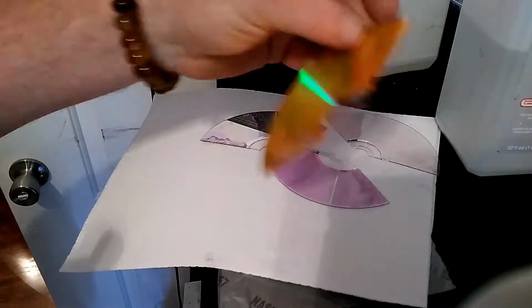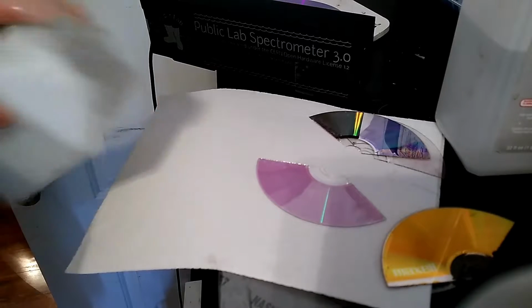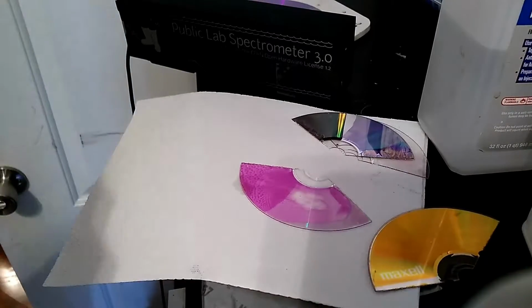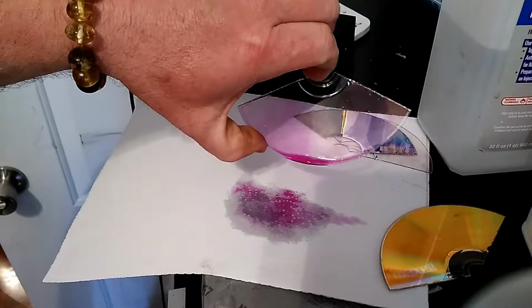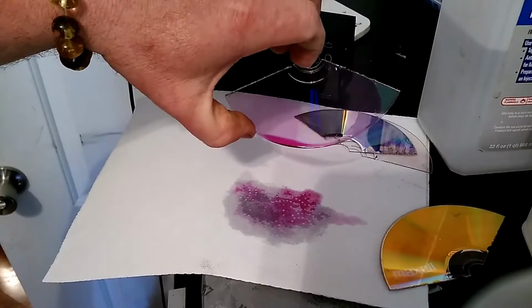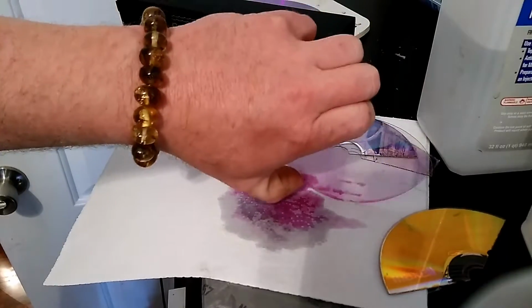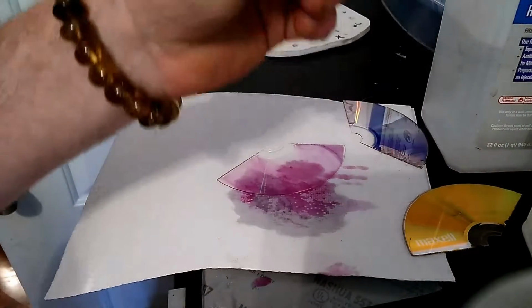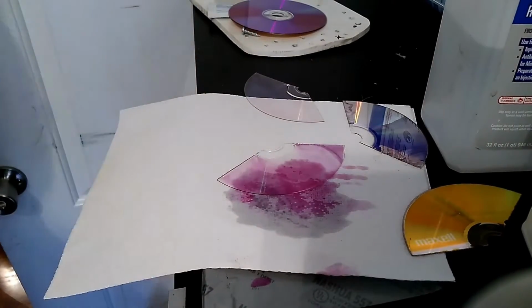I'm going to try a demonstration. I've never done one before, so I don't know if this is going to work right, but my neighbor gave me this. He had an old bottle of it. It's on one side, so I don't know if you can see that, but it seriously just separated right then and there without even rubbing it, and you can see it comes off. You can do it that way and use a soft cloth, or just do it that way, but no soaking, no rubbing, no nothing. And once it dries, it doesn't leave a haze. Oop, I just dropped my spectrometer. There's no white haze on there, which when I rubbed and rubbed with the 70%, I got a haze.